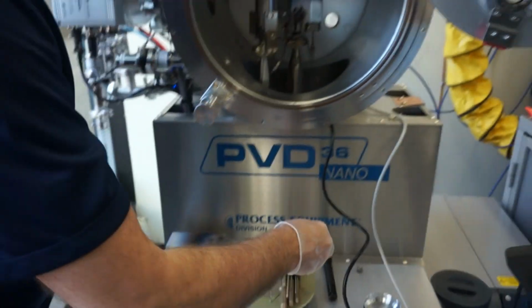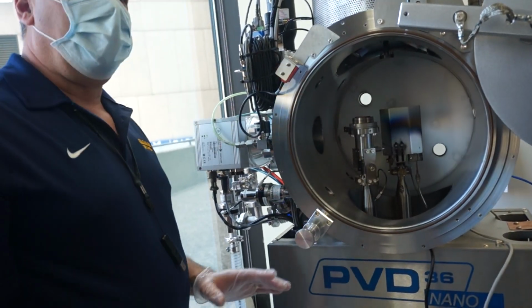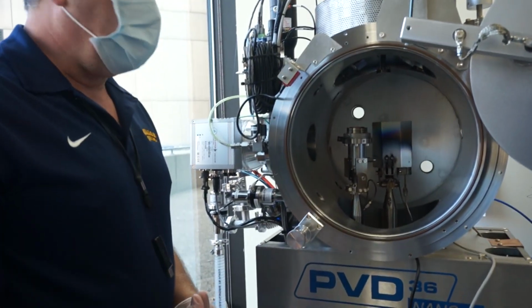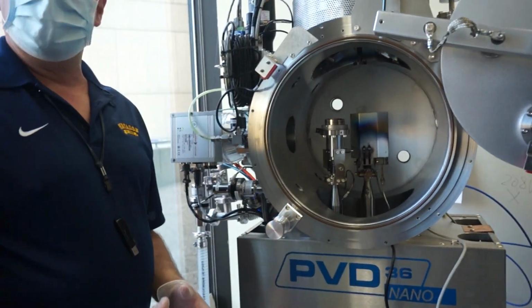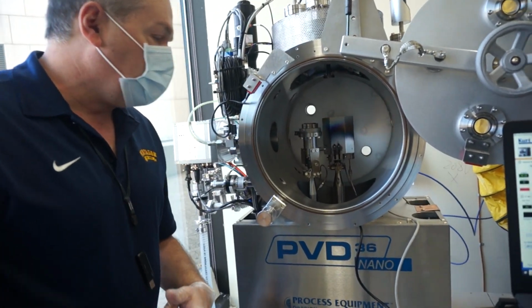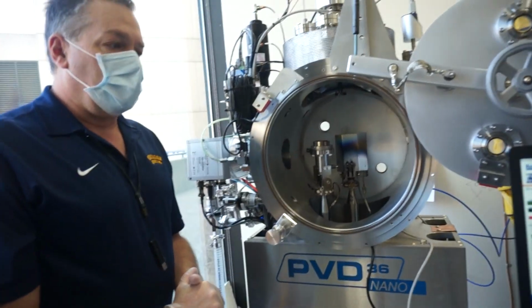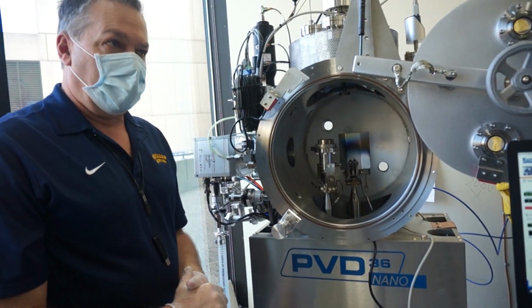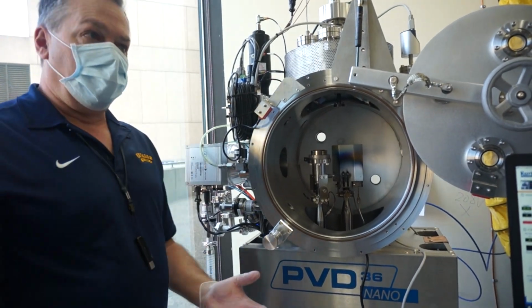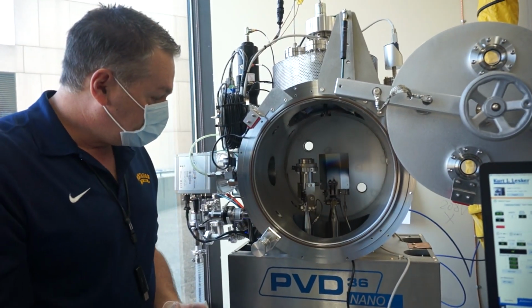So one of the questions I get asked, well, okay, Brian, how long can I use the target before it expires? That's really a great question because I don't know what your process entails. But what I can tell you is that through our software, and I'm going to show you, we have the ability to track kilowatt hours. I spoke to our applications department a few weeks ago because I had a similar question. And he said, hey, let's track it every 1,000 kilowatt hours and see where the erosion is. And then we'll set a threshold or a limit based upon that. And I'll show you how to do that software-wise.